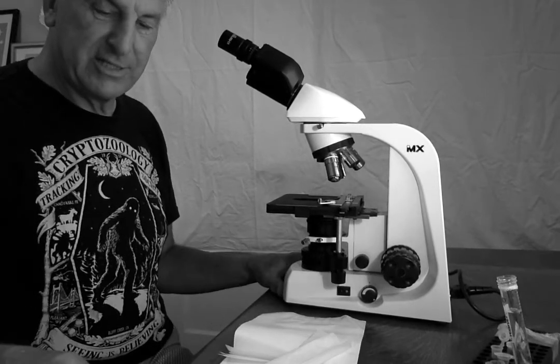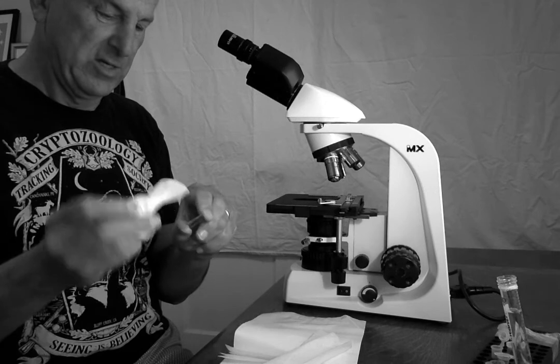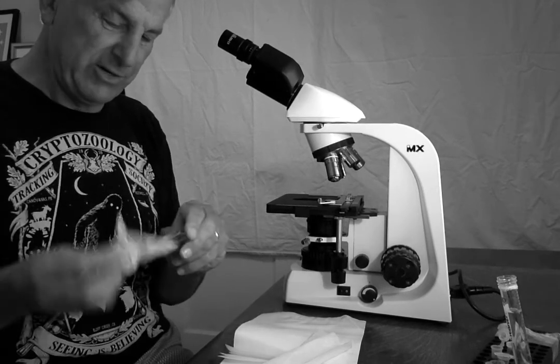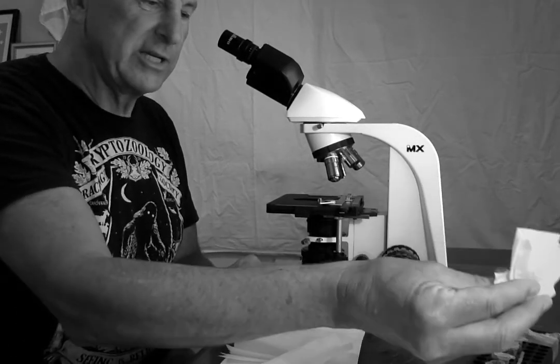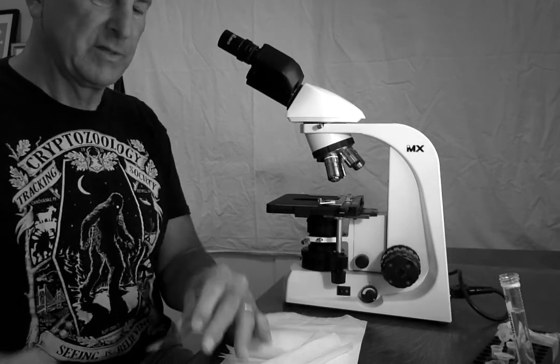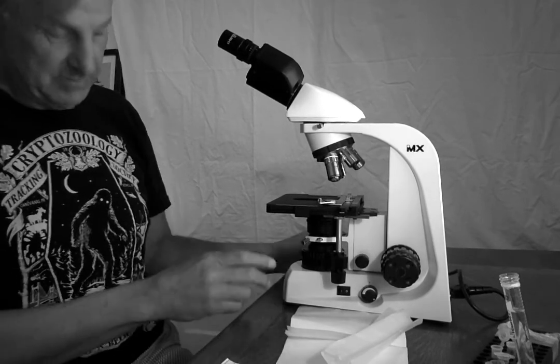I'm now going to get maybe a Kim wipe or something and wipe off the slide. And I'll get some cleaner and clean that up. Because we don't want any oil contamination hanging around, so we'll clean that thoroughly, and we may be wrapping up this presentation. I think we've covered everything I can think of to cover, so I'm going to stop.